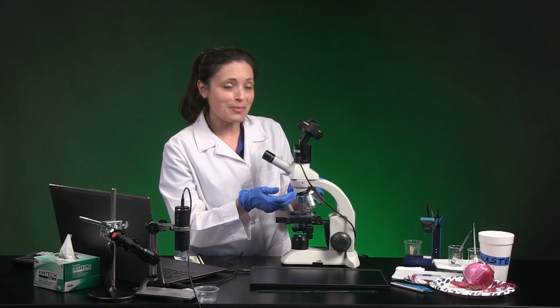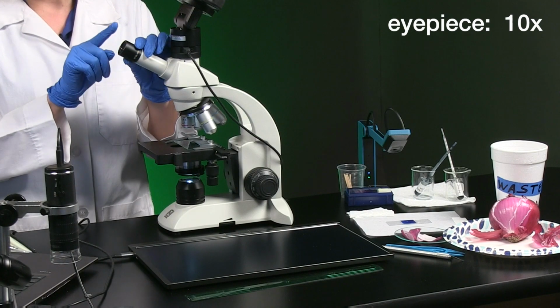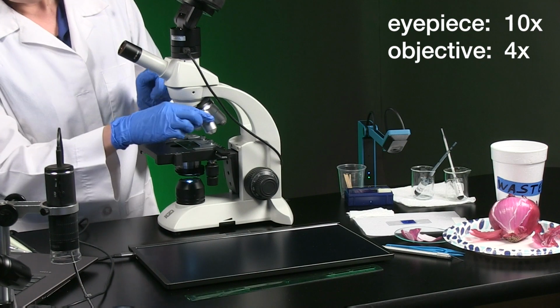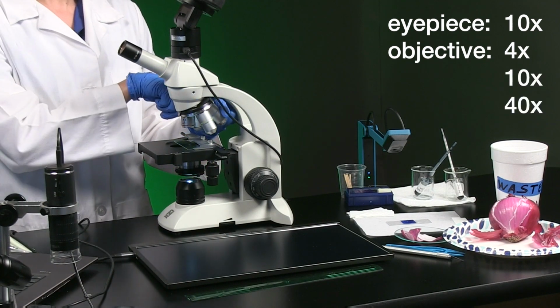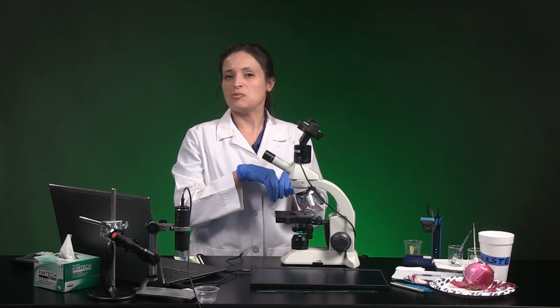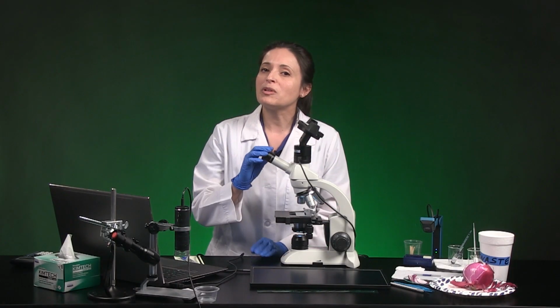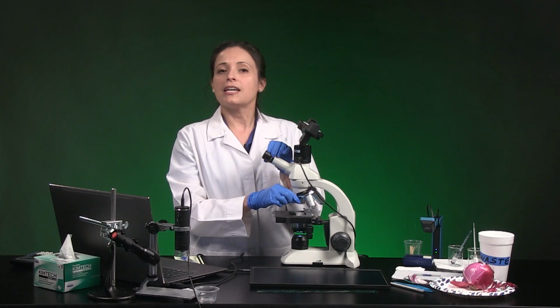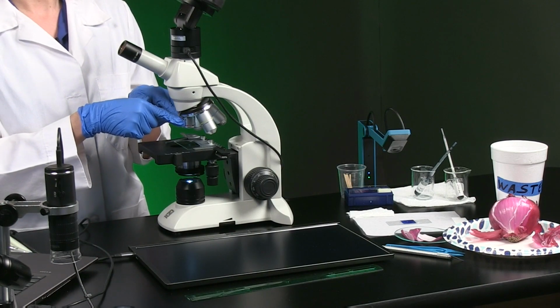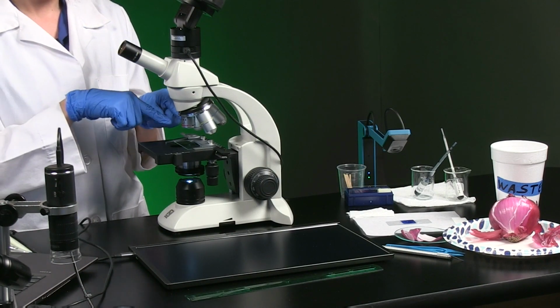First, there's the magnification power just looking through the microscope optics. The eyepiece has 10x magnification, and there is a 4x objective, 10x objective, and 40x objective lens. I won't be using the oil immersion lens, so we'll skip that objective lens. Remember to multiply the eyepiece times the objective to get full microscope magnification power. So when I'm on the 4x objective, the total microscope magnification is 4x times 10x, which equals 40x total magnification.